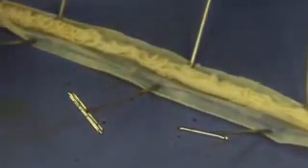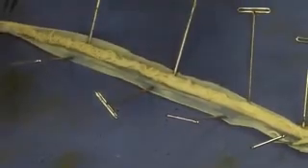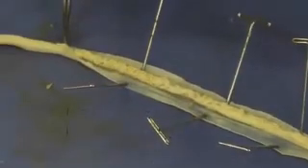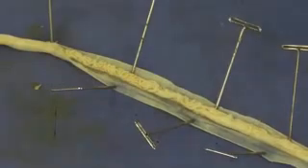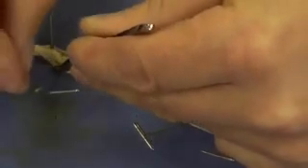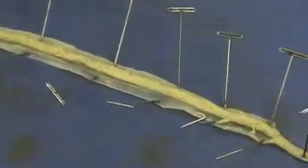I'm going to go just a little bit further, but you are going to want to go to the very end, or to where the most posterior pin is located. That looks pretty good for this particular video. Now I'm going to look around and try to identify some different structures.